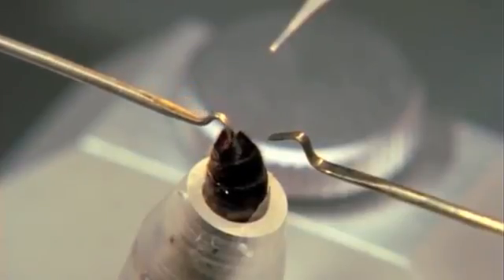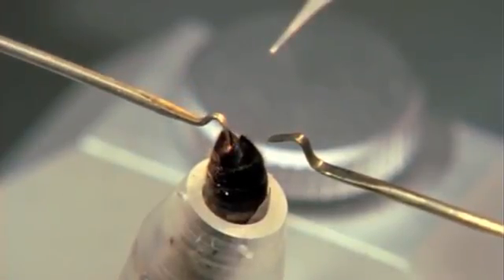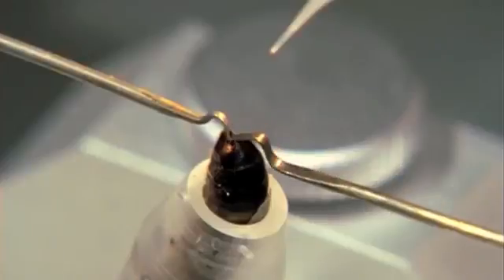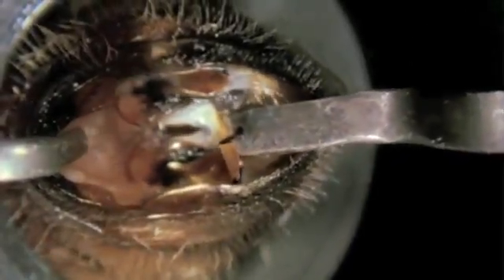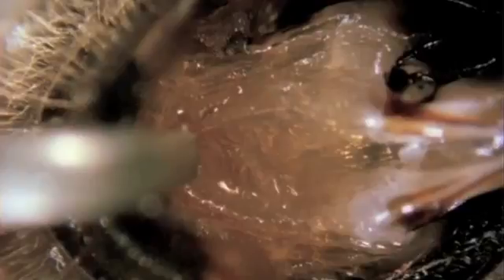The ventral hook, left, engages behind the ventral plate of the last segment. The dorsal, or sting hook—in this case a perforated hook—exposes the sting chamber. The sting lancets and epidermal folds are now visible. The vaginal orifice is recognizable as a wrinkled bulge in the middle.